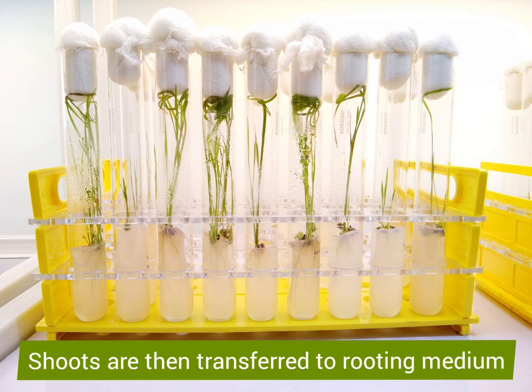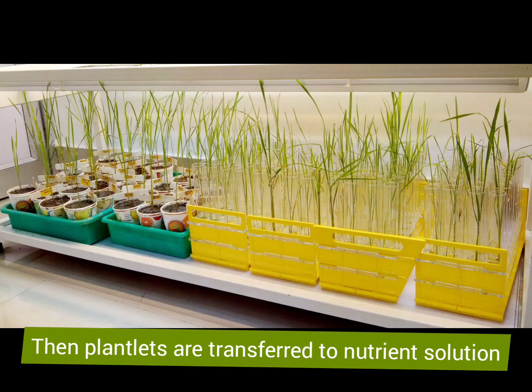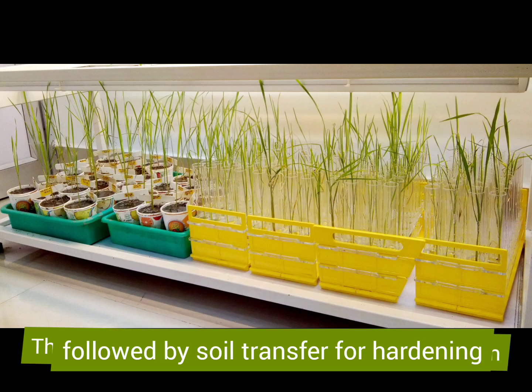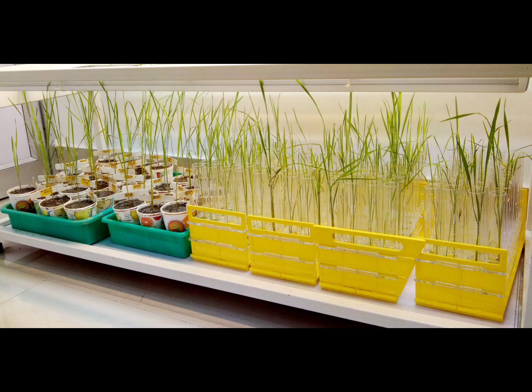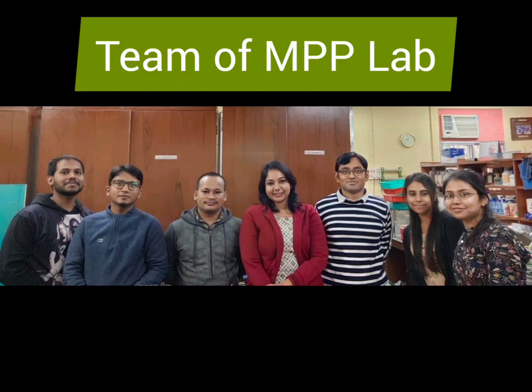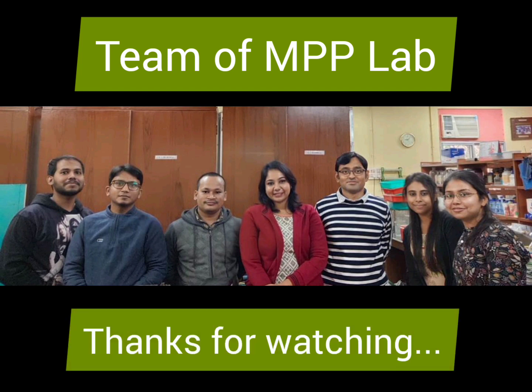Shoots are then transferred to the rooting medium for root initiation. The plantlets are now transferred to the nutrient solution, followed by soil transfer for hardening. In the end, we believe that this virtual tour will motivate you all to build your career as a future plant biotechnologist.